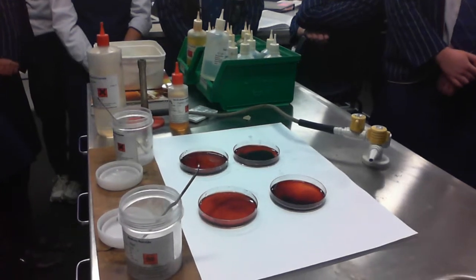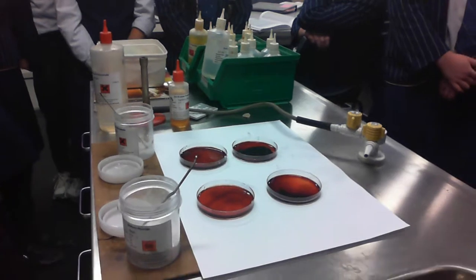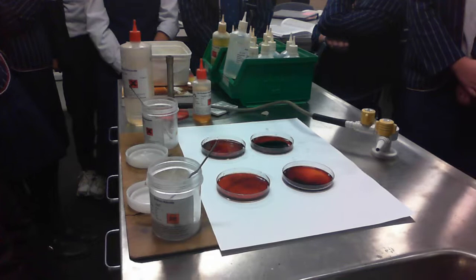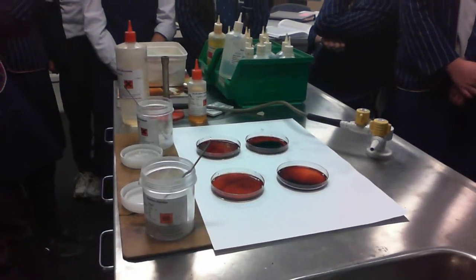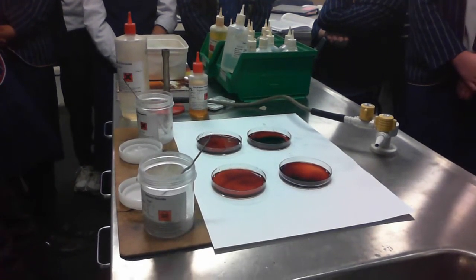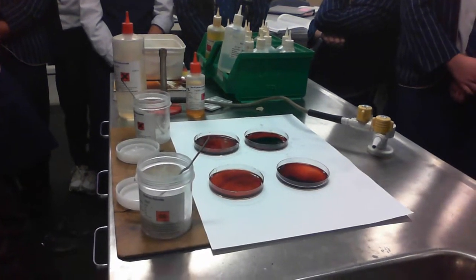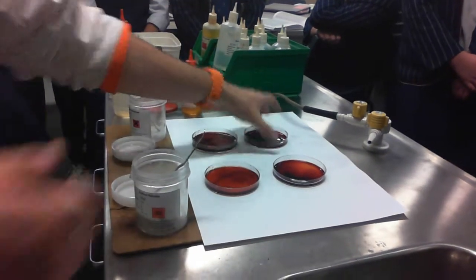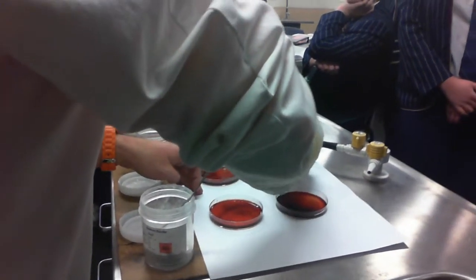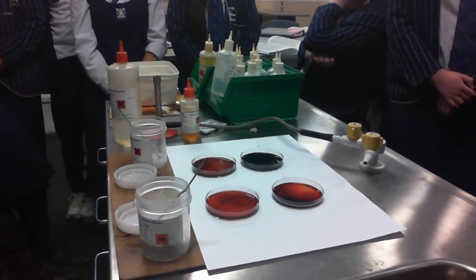The dark colour is due to the complex ion, the iron 3 thiocyanate ion. So it means that it's making more of the products. By adding more reagents, the equilibrium shifts in the forward direction to make more products. So the way that we say that is that by increasing the concentration of a reagent, it favours the forward reaction. Now it favours the forward reaction until a new dynamic equilibrium is created, and that'll be our new colour. So the more I swirl that, the more it should actually react until we get the same sort of colour through the whole lot. What was the next thing that we were told to do?